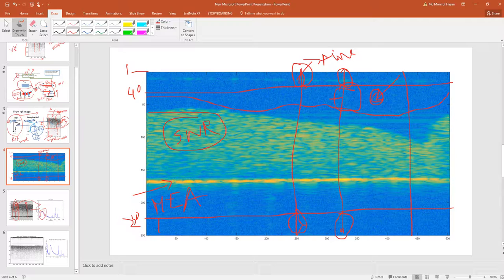So if we subtract each individual line's noise, that means we are taking care of any particle streak or any kind of unnatural thing that is only applicable for particular lines. We are subtracting in a different way, subtracting whatever amount we are supposed to subtract from each line. This method you can apply when there is a particle streak.